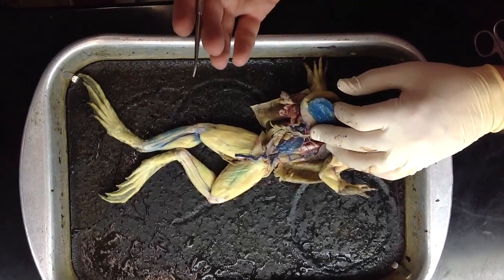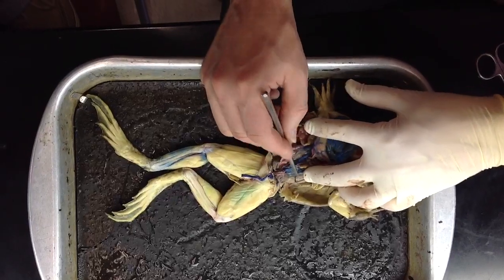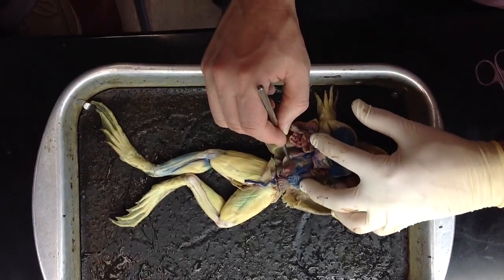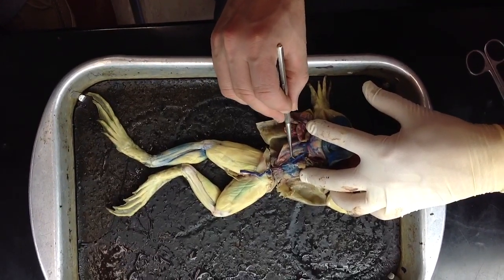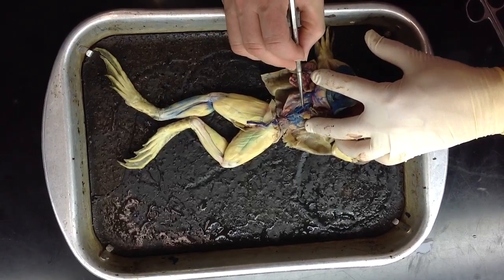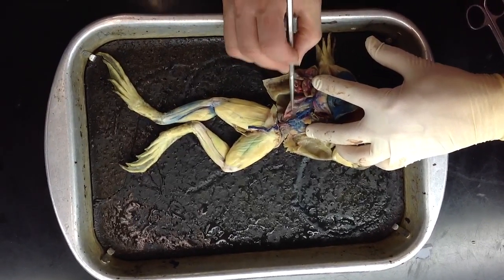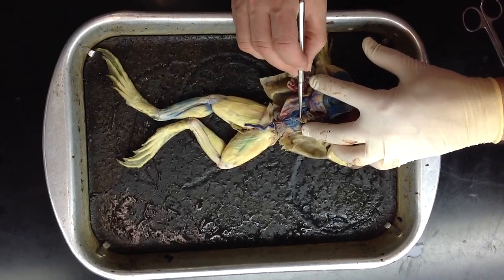Okay, now blood's gotten in the kidney. How does it leave the kidney? And it does so by entering into a posterior vena cava right here, which is formed by all these tributaries from the side coming together, which are urogenital veins. And they're draining from kidneys and from gonads, in this case a testis.